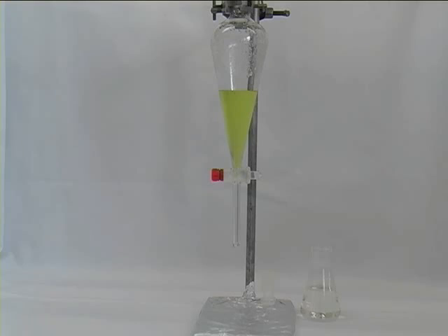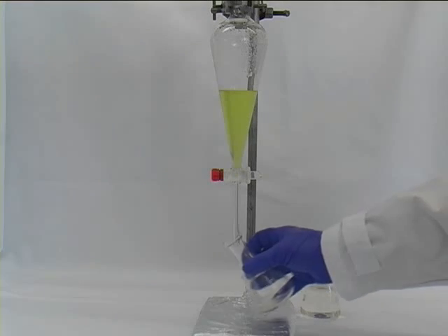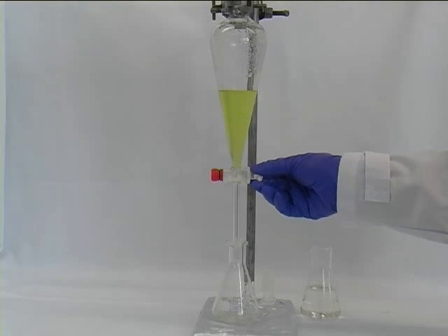Not just discard yet, just keep it in a conical flask until you are sure that what you want to collect is in the other phase.